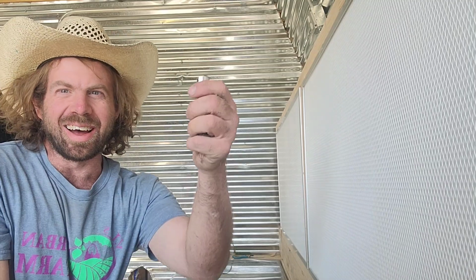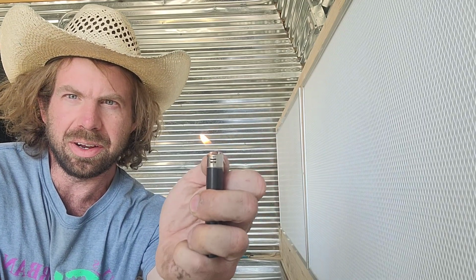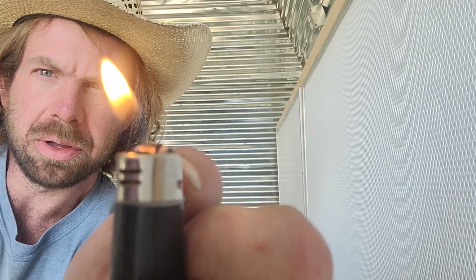Okay, everyone. So we're over here. I'm going to do this flame test, and I got an incense stick burning behind, so if there's smoke that comes into the camera, that's what it is. But first we're gonna do the lighter flame test, and you can see as it's in the camera frame and we are in front of the flow hood, the lighter is angled over, okay? And you should see it go vertical as I get closer to the camera.